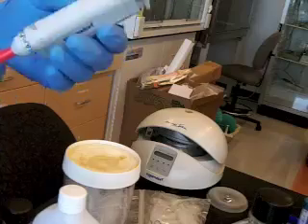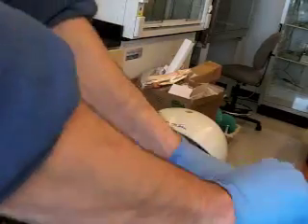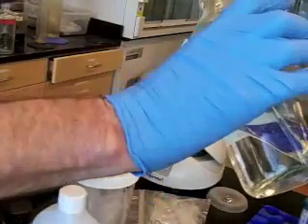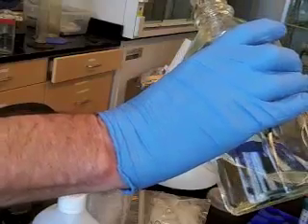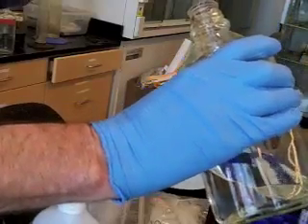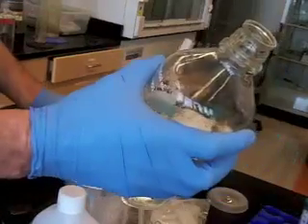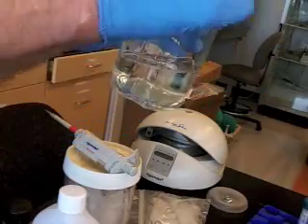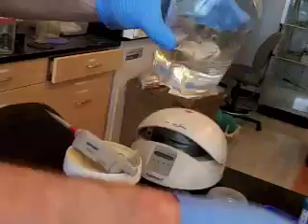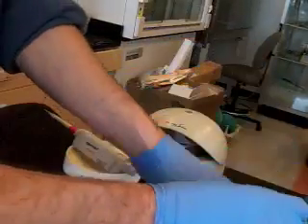Okay, then the next thing is, if the shaft is dirty, you also don't want to do this when you're micropipetting. You can put the tip, clean tip, into a bottle or test tube like that, but you don't want to put the shaft in to the tube. How can I pipette out of here? And the answer is that scientists, if they had a large volume with a small volume, would get a smaller tube and they'd pour some out into that smaller tube so they could safely micropipette out of this.